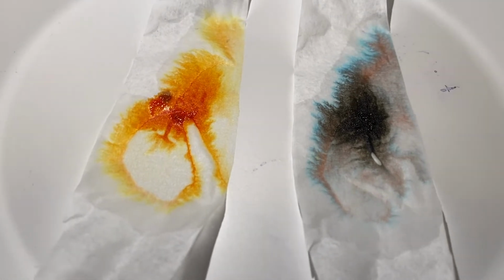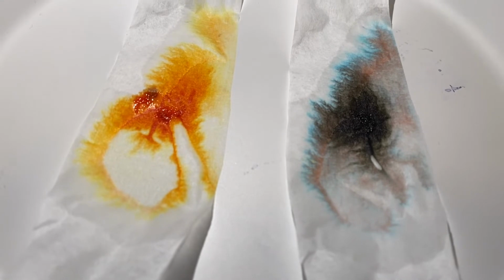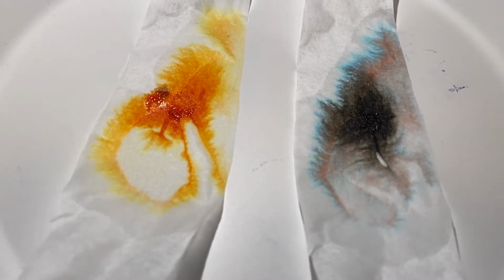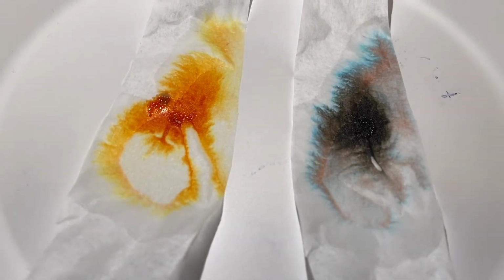Okay, it's pretty cool. By using the separation procedure of chromatography, we were able to separate Kool-Aid into the individual dyes that make up that color. Pretty neat. All right, and again, our solvent there was just water. Okay, so now that we're done with activity number 3, we're gonna go take a look in on activity number 2 with our nature's colors and see how well our rubbing alcohol solution turns out.